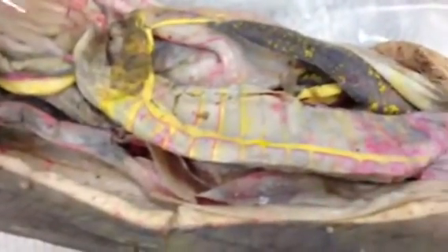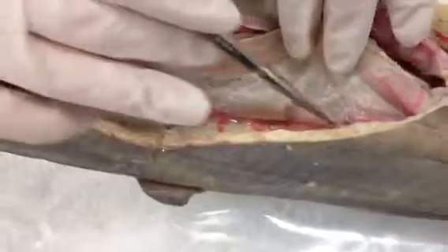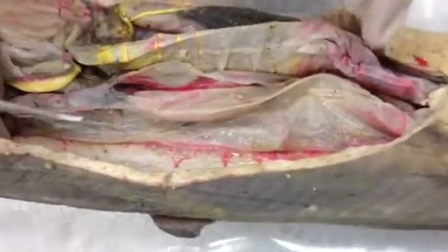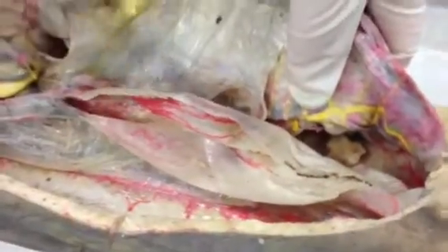Not all organs are covered — some are retroperitoneal. Those would include the kidneys, which you can see better on the caudal region along the dorsal wall. The kidneys are retroperitoneal, and in cats part of the duodenum is retroperitoneal as well.